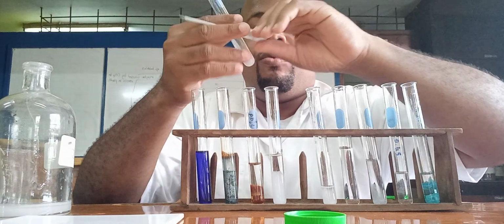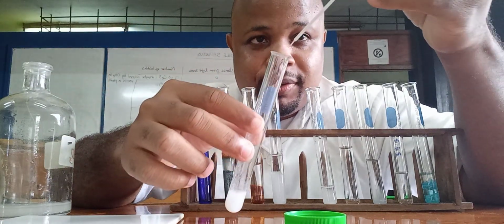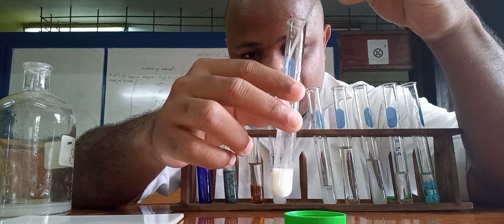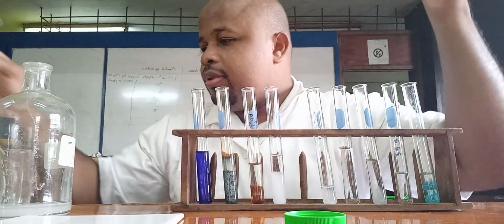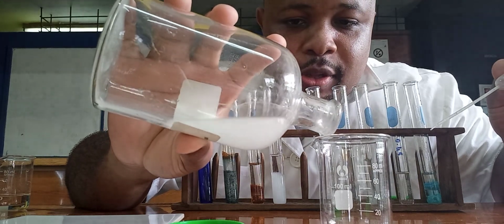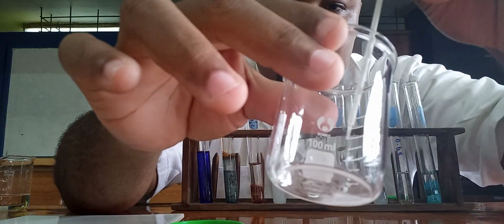Now I only have a little potassium iodide, so I poured out a new solution of lead. So let's see. It's not changing. Nope. Just a second. Alright, so I'm pouring out just a small amount of the lead. Alright, and let's see if this one works. Alright, yes, so there it is.